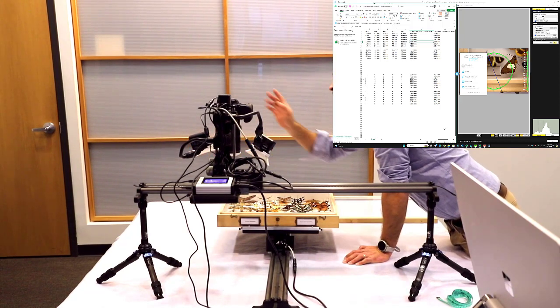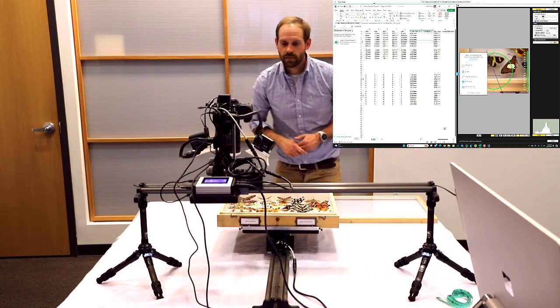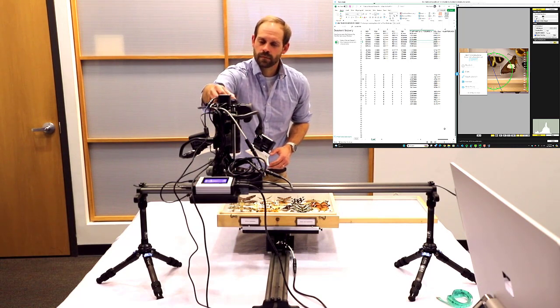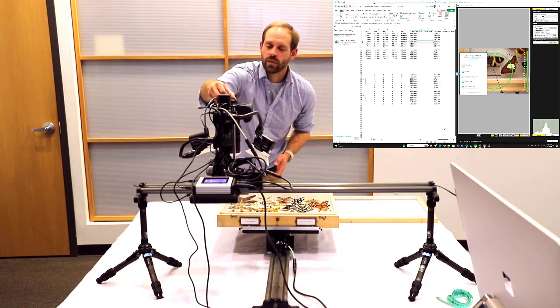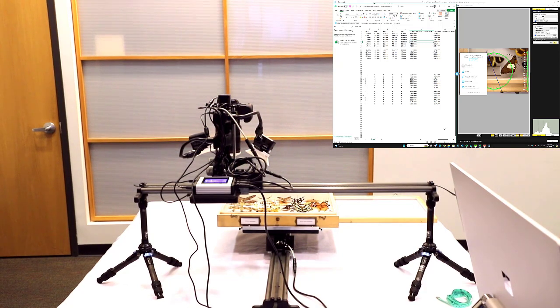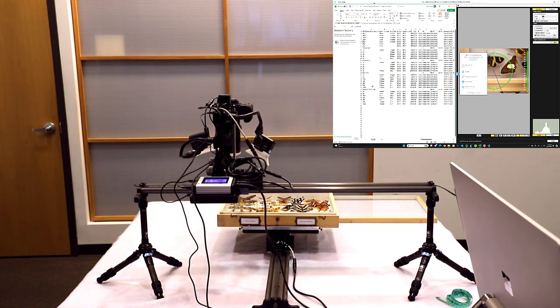At the moment, everything is set to a power of 1/8. You just make sure that that's tied up with the transmitter. We're on channel 21. So 1/8 might be a little bright. I recommend 1/16. We might have to go back to 1/8 because we are using an aperture of f11, but I'd like to compensate that with ISO. Again, those settings are going to be already predetermined for you in this table.